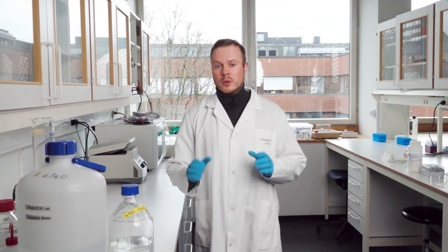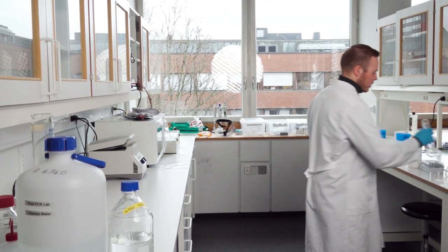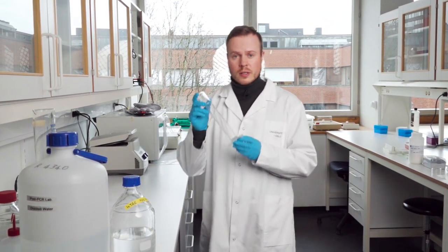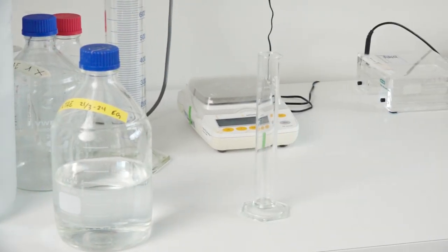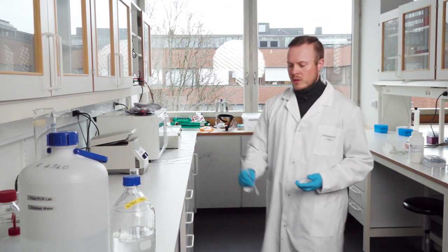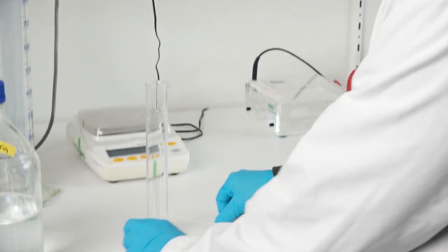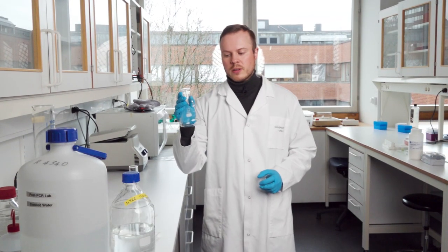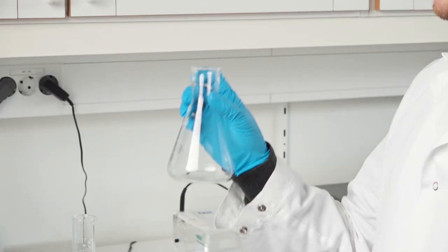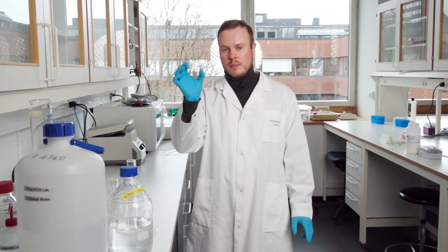I'll go through all the required gear needed to make the gel. First, I need a graduated cylinder to measure the amount of TAE buffer we need. We need a plastic spoon, a small measuring tray, a glass flask capable of at least taking 100 milliliters of TAE buffer, and a small glass cap as well.